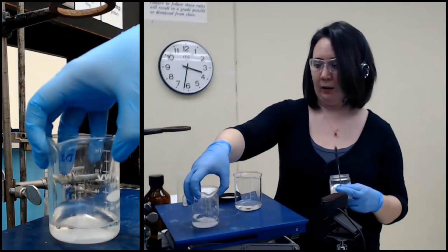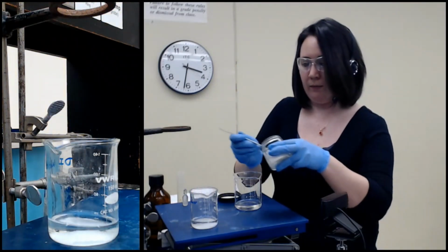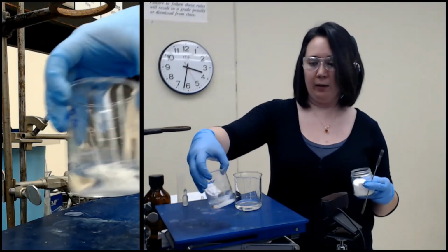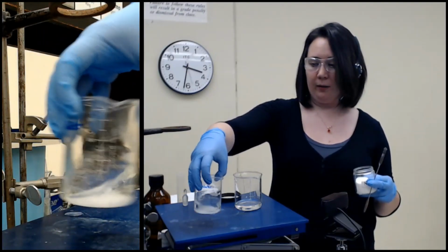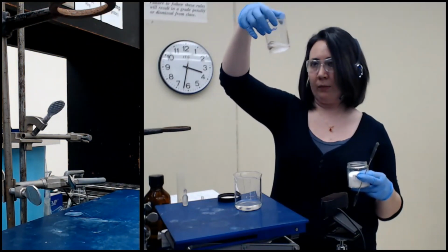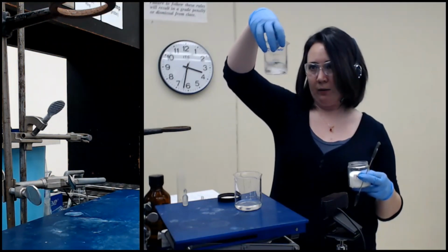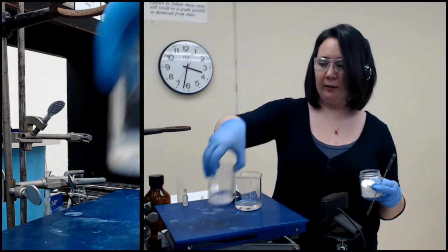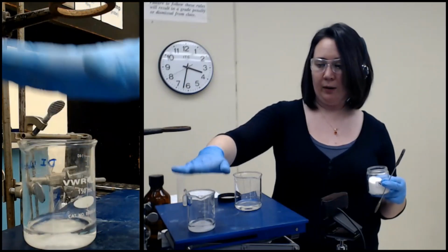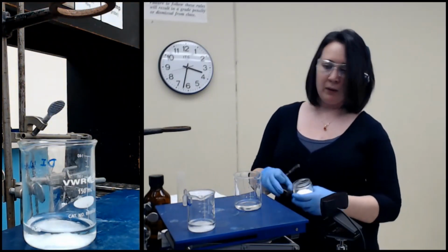Okay, do a touch more. And so you can see it didn't actually look very wet, right? It's not like we could see water, but the sodium sulfate is finding something to react with. Okay, so now it's hard to see, but there are some loose grains in there. It's not all in this one big clump. So I'm going to let that sit for a moment.